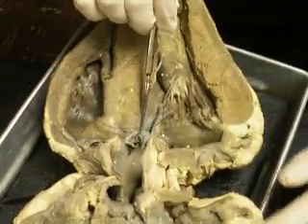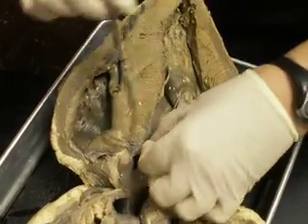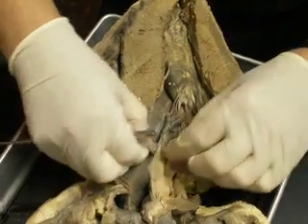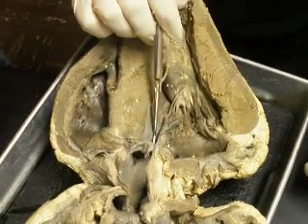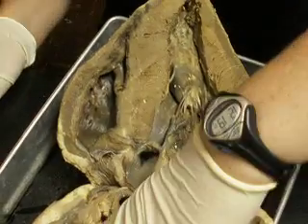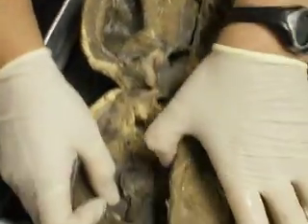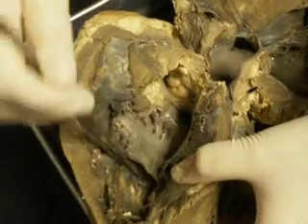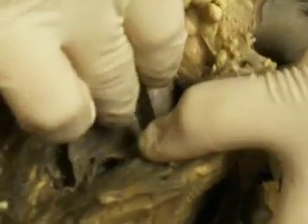Blood comes out of the left ventricle and goes into the aorta, which is right here and here. So this rubbery sheath, that's the aortic semilunar valve. The tricuspid valve you can see inside here. There's the tricuspid valve, okay, chordae tendineae. And then also in this heart, that's the coronary sinus in the right atrium.